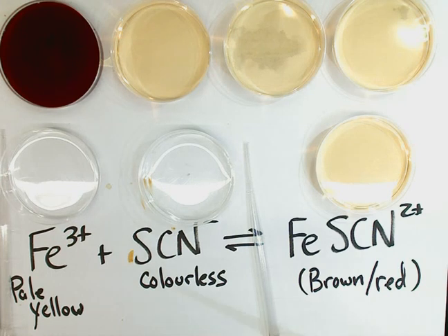If you dilute the solution by adding lots more water, you can get to the colors we see in these four dishes. These four dishes all contain the iron thiocyanate compound, much more dilute than the dish on the far left. Now, one question: how can we tell that these dishes — all five of them, the four light-colored oranges and the dark reddish-brown one on the far left — have all reached equilibrium?